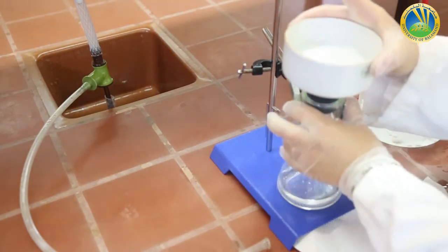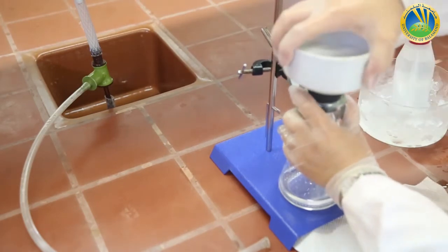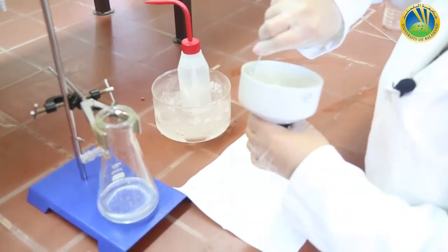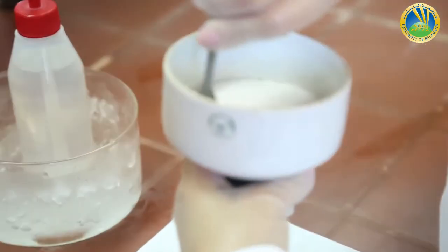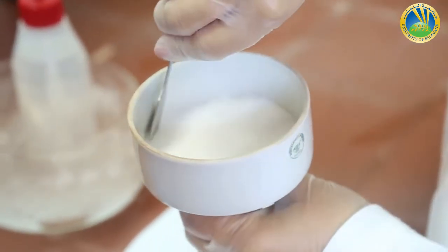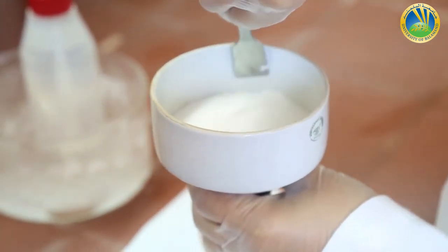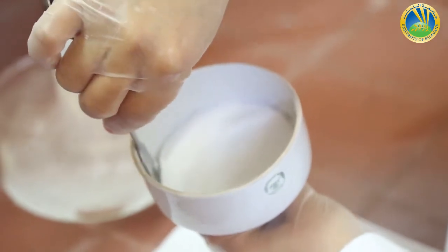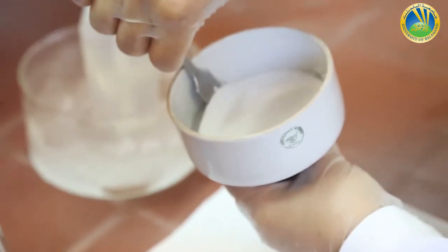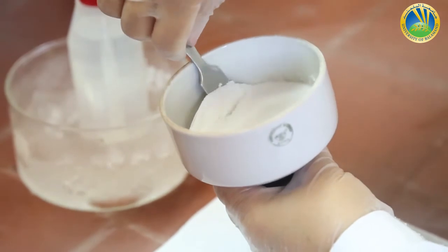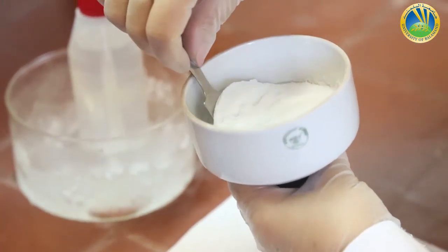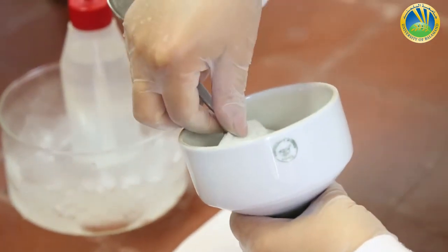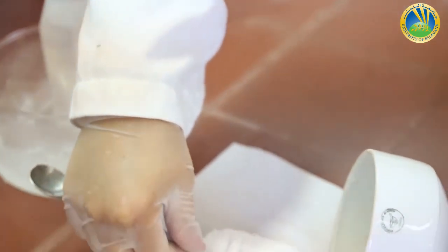I have to remove them with a spatula to put them inside the oven. Now with a spatula I try to get the filter paper with the crystals on it. I can put it on a watch glass on an A4 sheet inside the oven and let it dry.